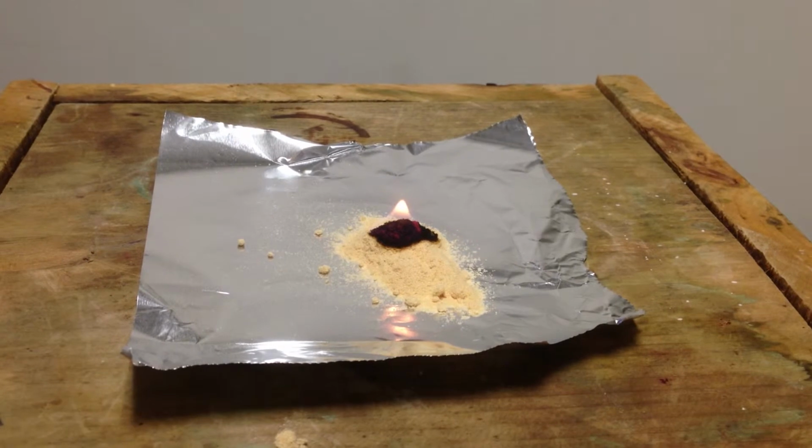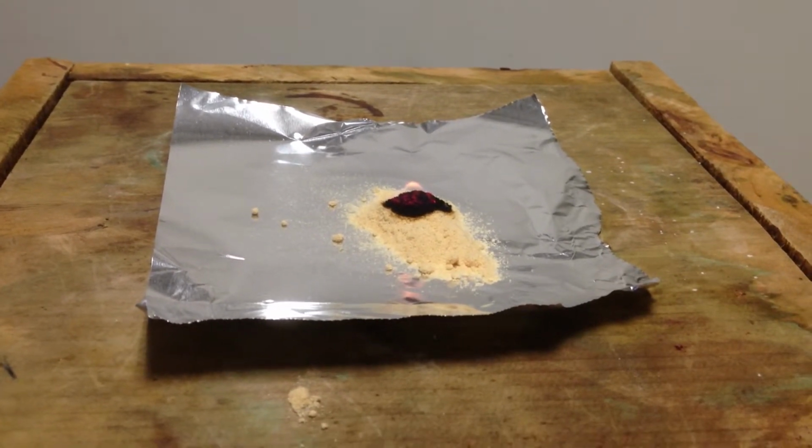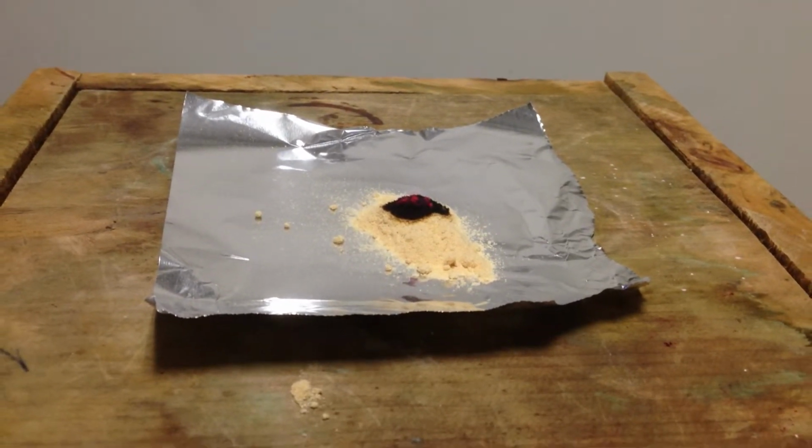But it's not burning at a very fantastically fast rate, very slow rate. Only the outside of the pile of sawdust is burning. In fact, now it's out. So not a terrifically fantastic rate of reaction here. But what I can do is take that dust, and if I was to expose all of that dust as a powder over a flame, the rate of reaction would increase.